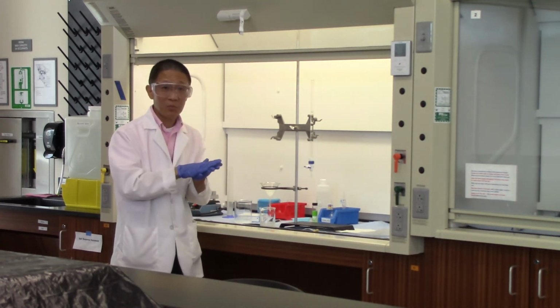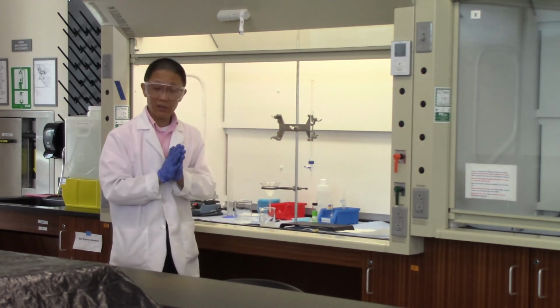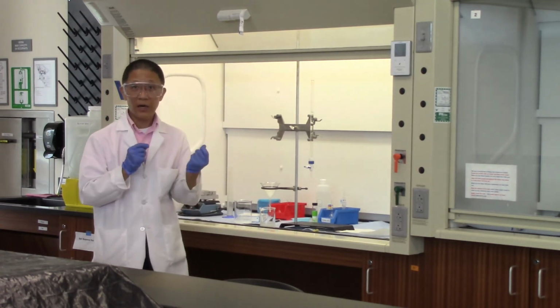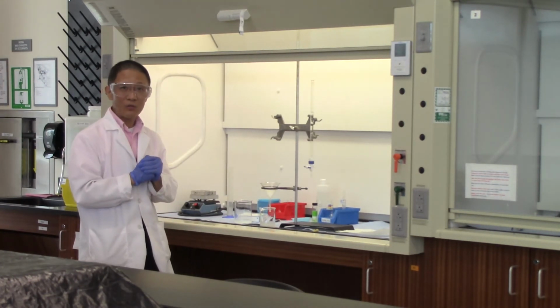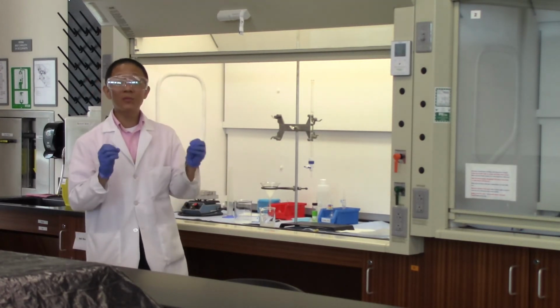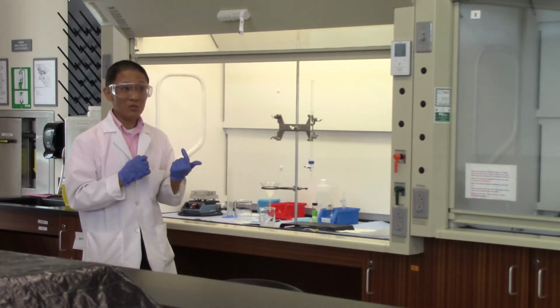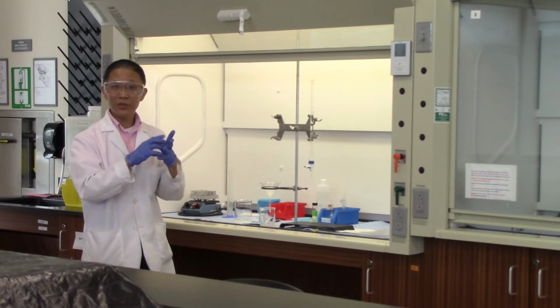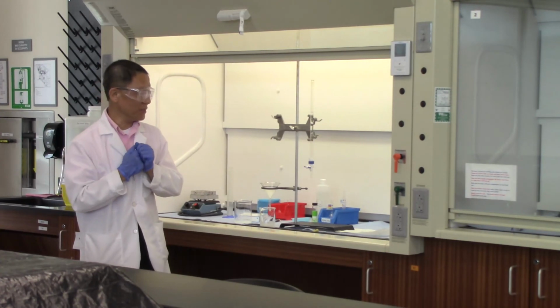Once we get the mass of the barium sulfate, we can go back and do the calculation. Using the three equations that we put on the whiteboard, we will be able to figure out the percentage of sulfate ion in the sodium sulfate sample. That's pretty much all you need to do in this experiment. If you're doing the lab with 3 hours, the lab instructor may ask you to do 2 trials with the same sample. After the 2 trials, you will be able to take the average, with the hope that the average percentage is going to be closer to the true value of the percentage of the sample.